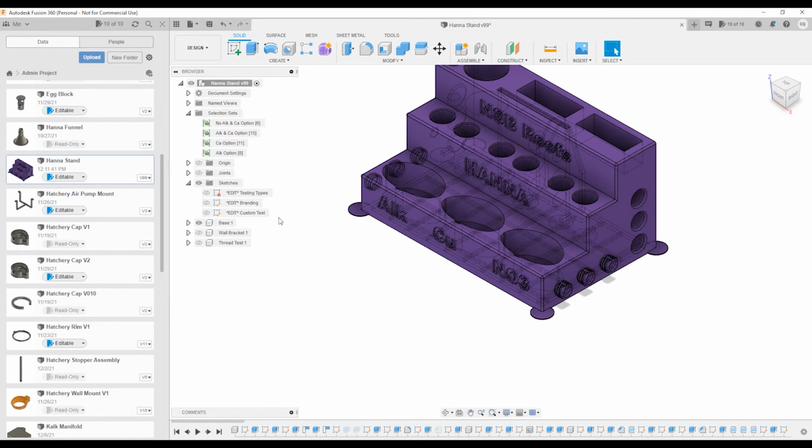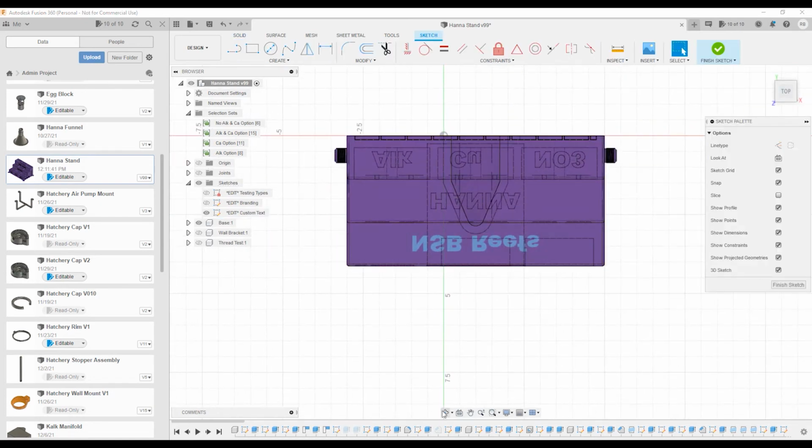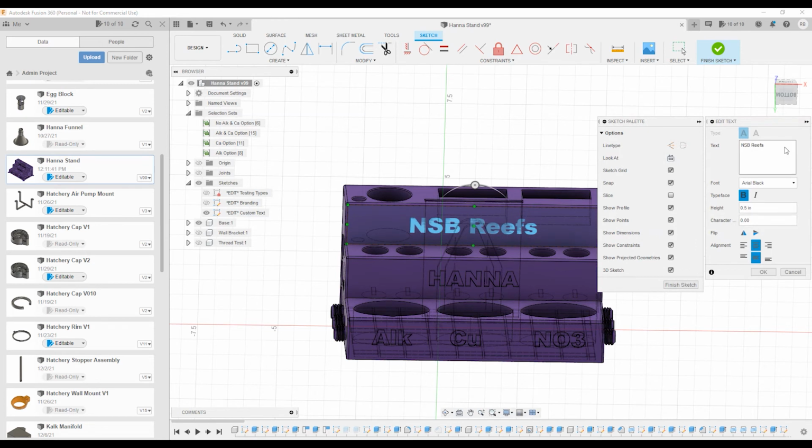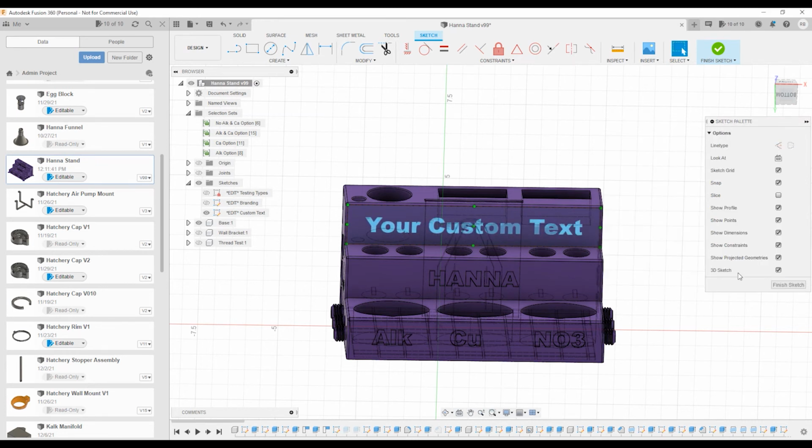Now you can also change the branding, which is the middle row. So if you don't want it to say Hanna, feel free to change that. And then the custom text is the top row. Now I've messed that up a little bit. You can see that it's off base a little bit. So just flip it around, double click on the text, and then put in your custom text. Say okay. And you can change the size.